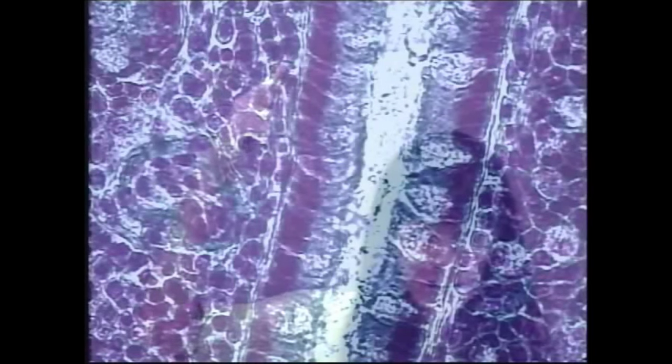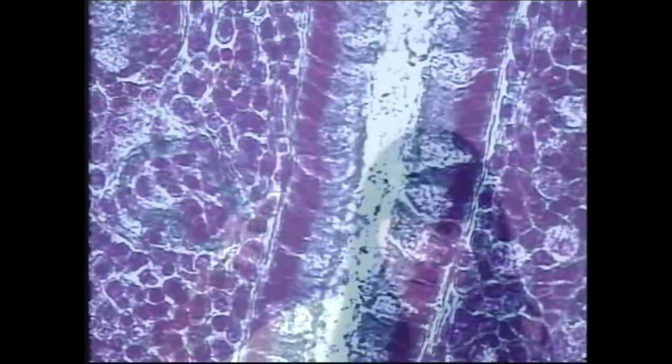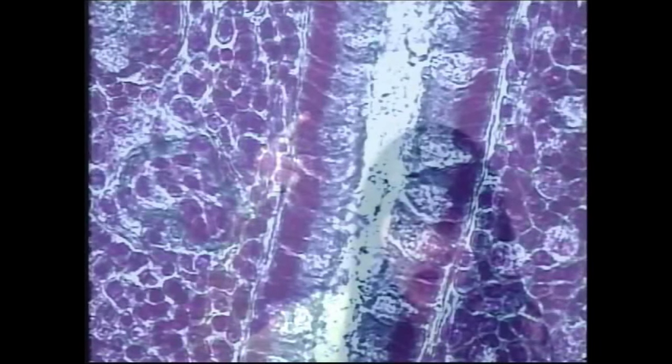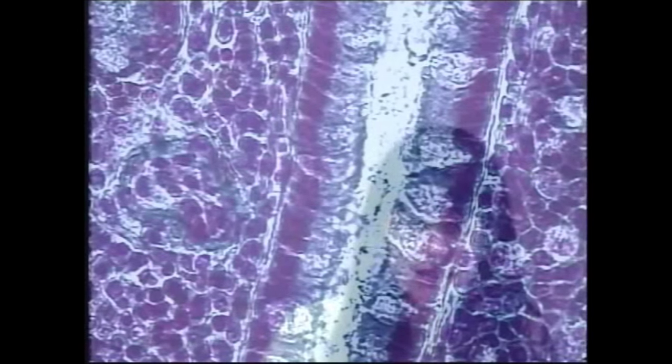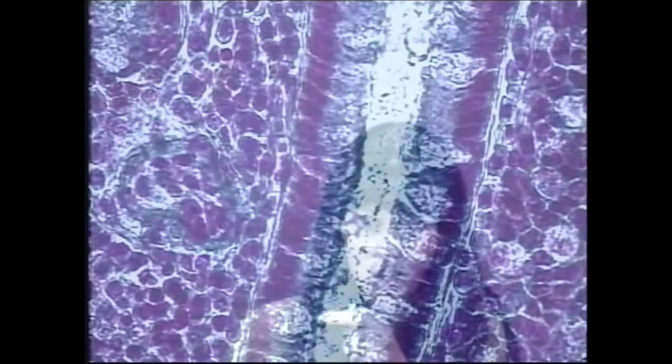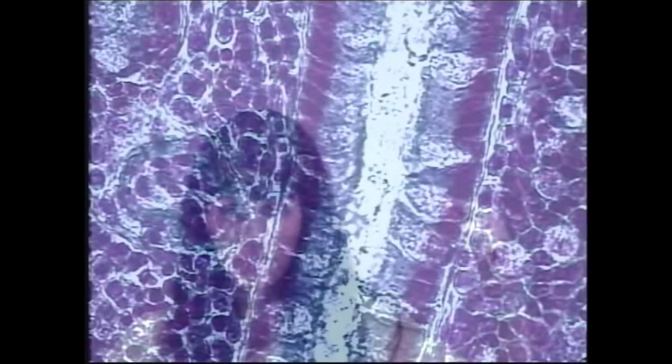Let's take a look at our simple columnar epithelial cells. As you look at this slide, you'll see a layer of elongated cells — all these little red dots are the nuclei along the basement membrane. From the red nuclei, you'll see blue cytoplasm extending toward the free surface. The goblet cells are the clear cells — there's one right here, and here are some more goblet cells embedded within the simple columnar epithelium.